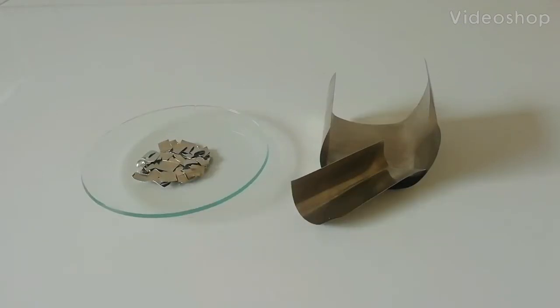Hello everyone, welcome to my YouTube channel. Today we are going to make nickel chloride. As you know, nickel compounds are a little bit expensive, so I bought some nickel sheets. This is a pure nickel sheet you can see here on the right side, and I have already cut five grams of nickel metal into little pieces.